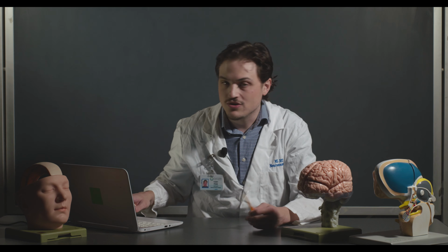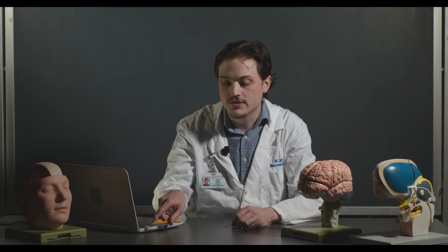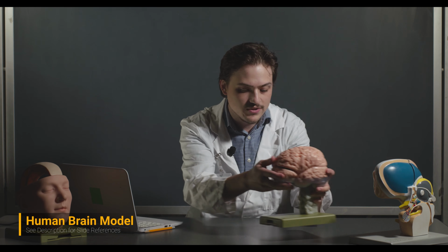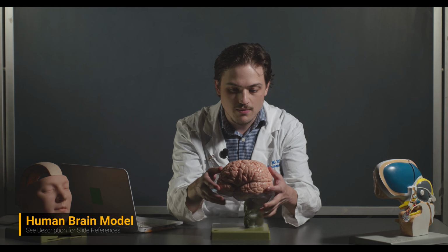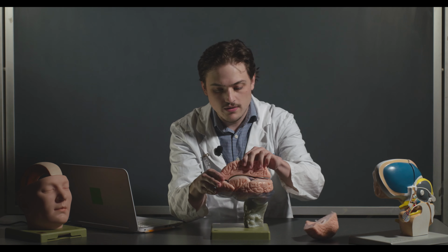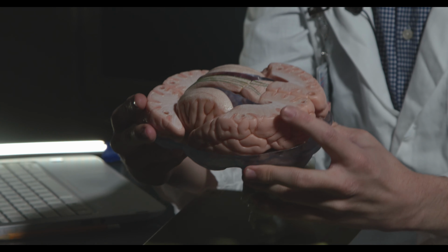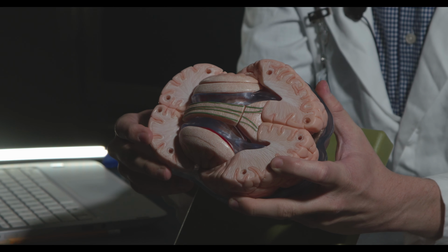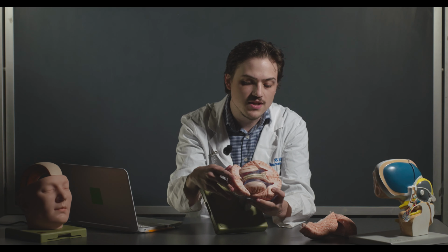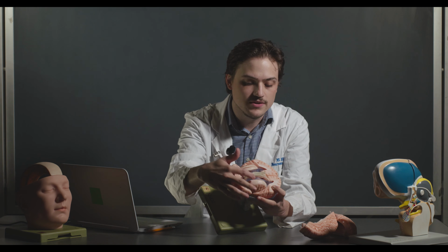In your lab manual, the first couple of slides are just the organization of the lab as it normally is. But really what I want to talk about first are the basal ganglia and thalamus structures. So I'm going to focus in on this human brain model here. If we were to remove parts of the cerebrum, you can see some of these structures a little bit underneath. So we're going to hone in on these here. I'm going to pull them out so you can see them a little bit better.